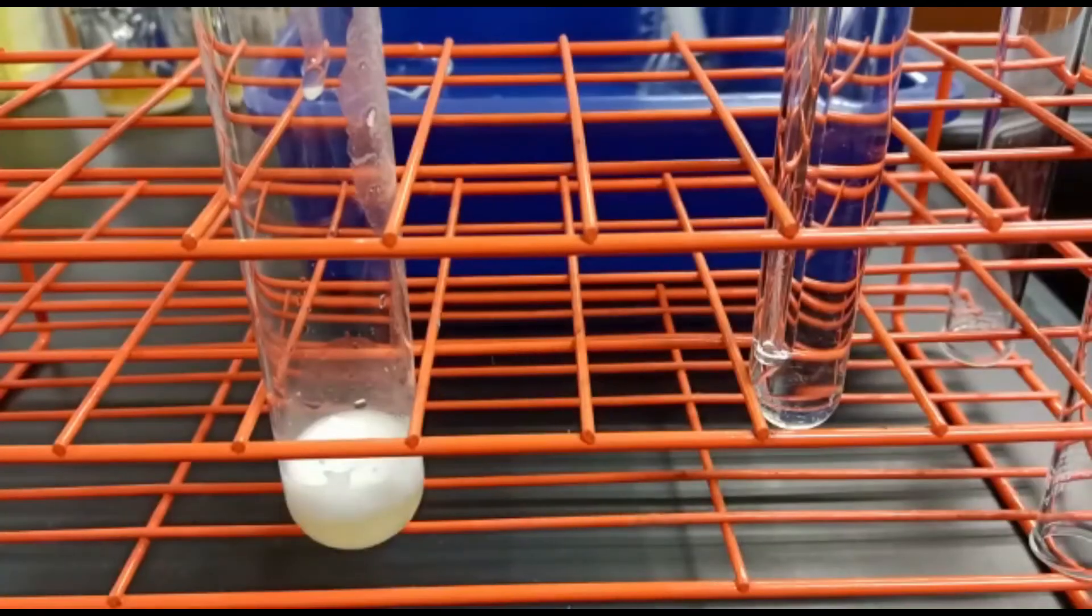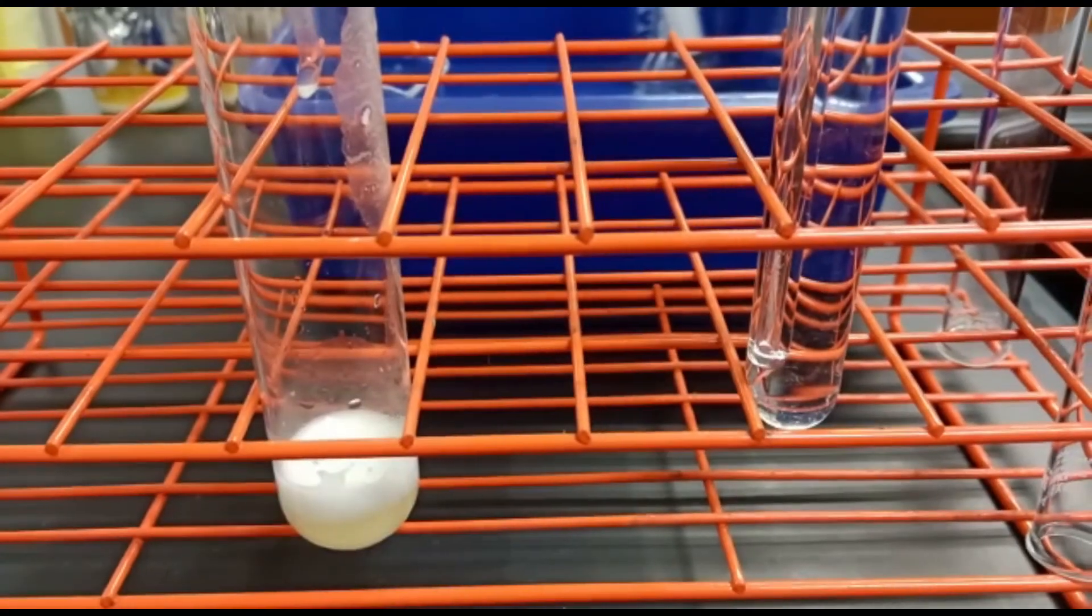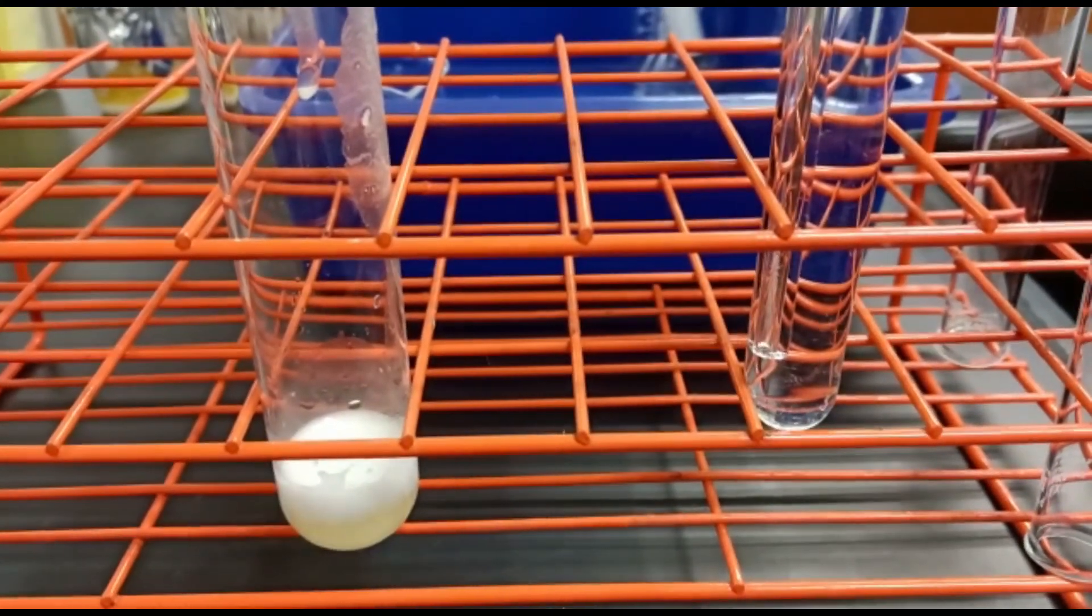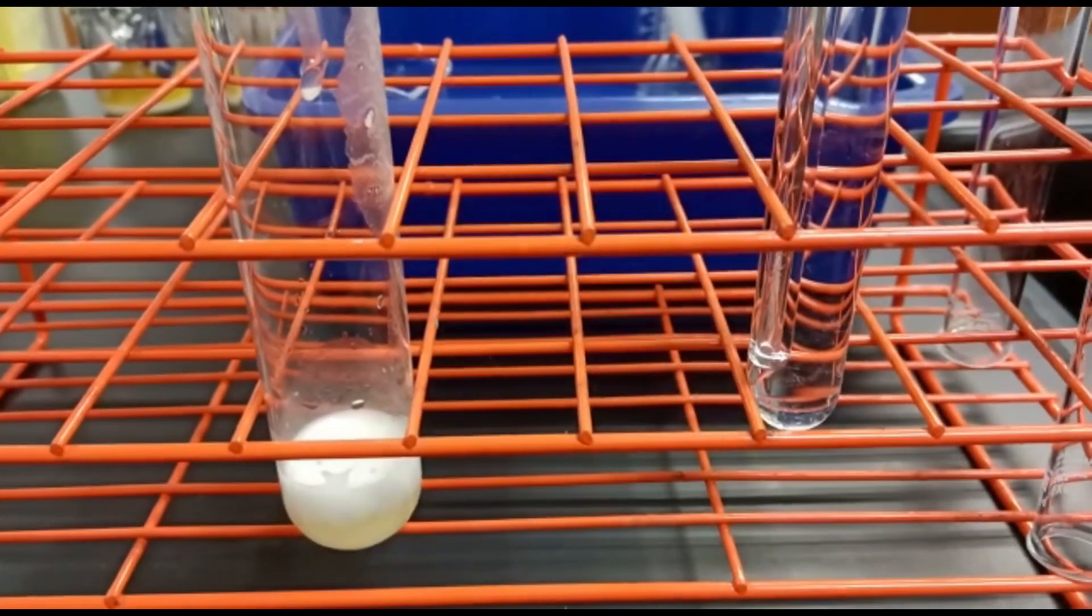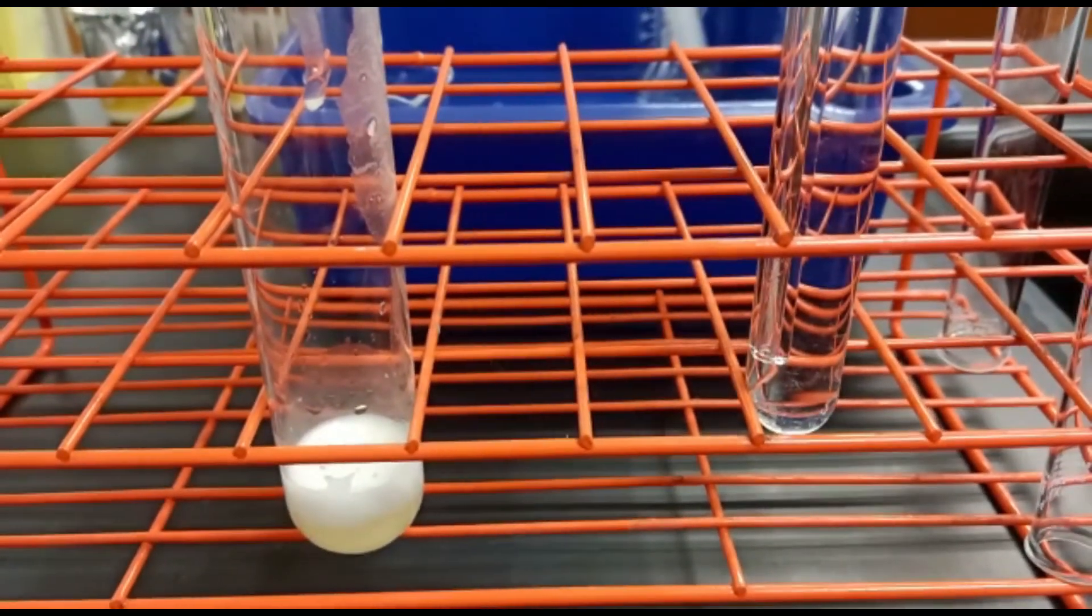Okay, this next clip is slightly better. We can see the bubbles slowly forming here. This is the oxygen gas being produced as a result of the reaction.